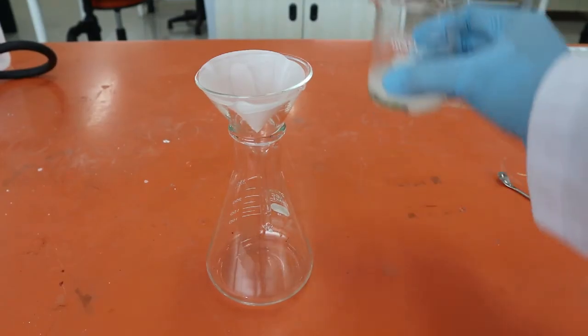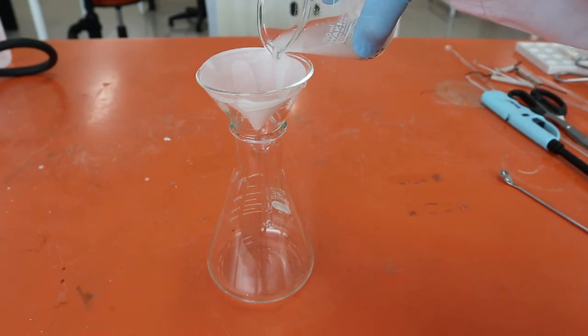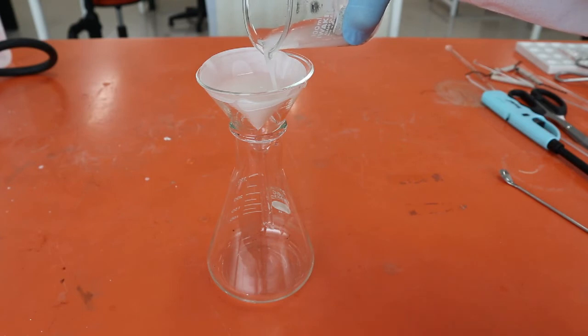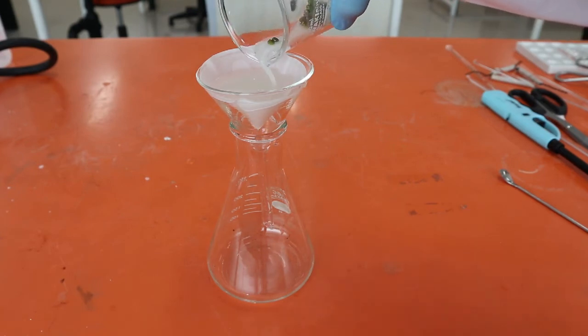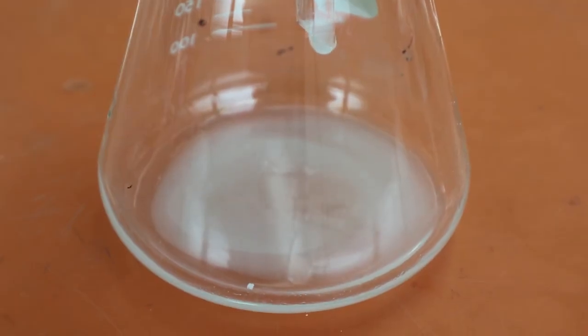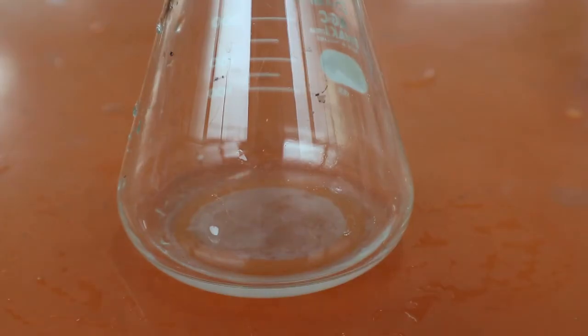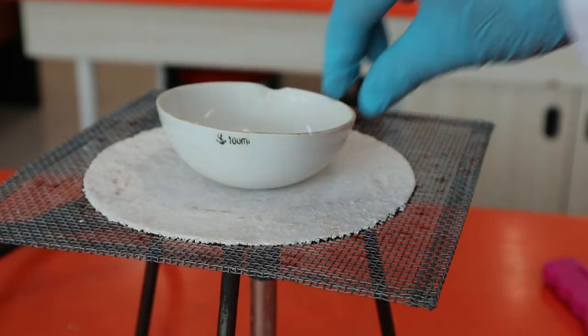Simple filtration using filter paper in a funnel separates mung beans instantly. It is because the size of the mung bean is much bigger than the size of the pores of the filter paper. We may need to repeat filtration with new filter paper to completely separate powdered chalk from the mixture. After the chalk is removed, a clear solution is obtained. Salt has dissolved well in this solution.